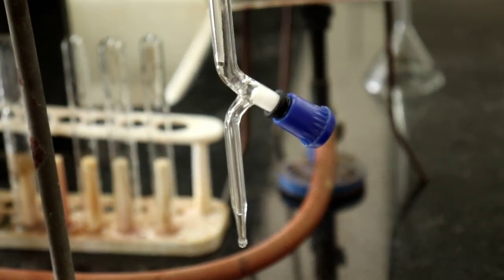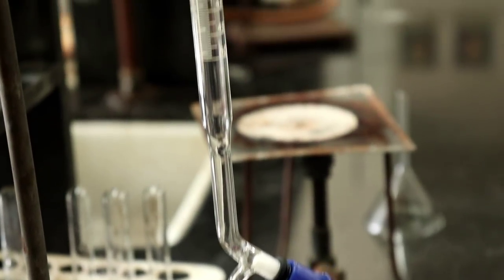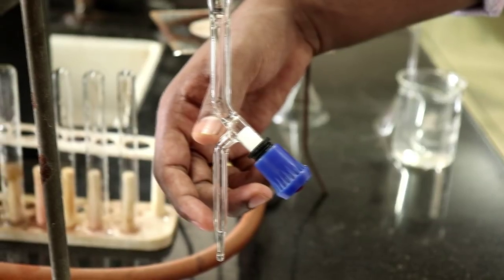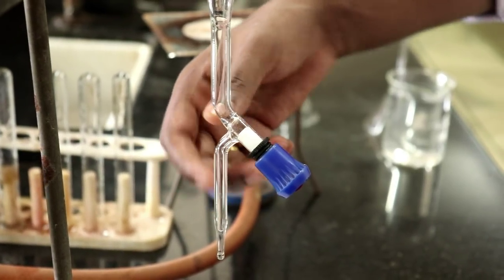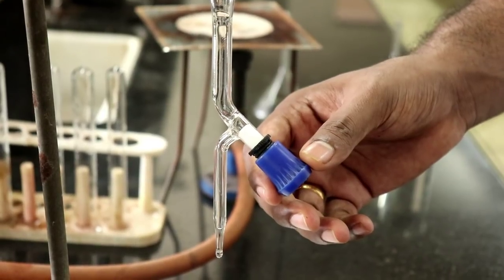Hello friends, today we will study how to use a burette in a proper way. This part is the tip of the burette. This is the stopcock which will help you to control the flow.